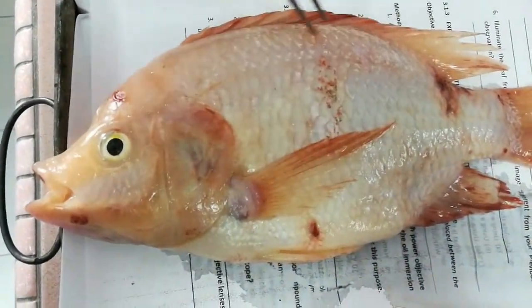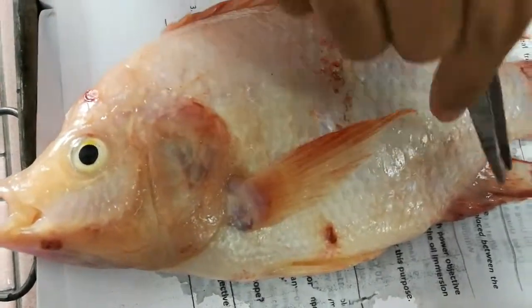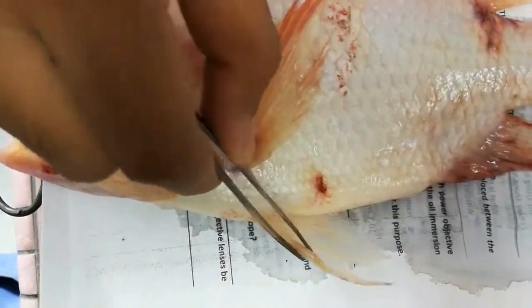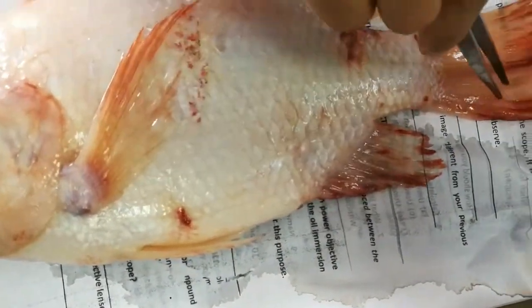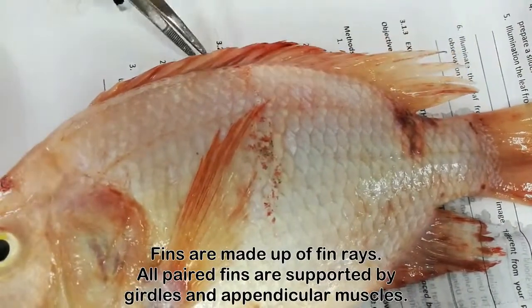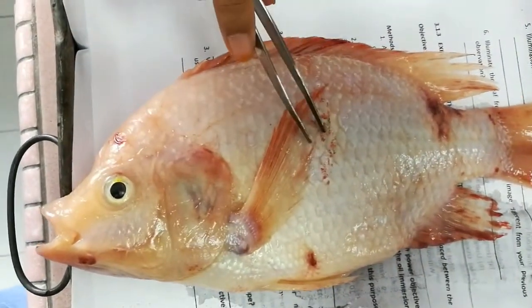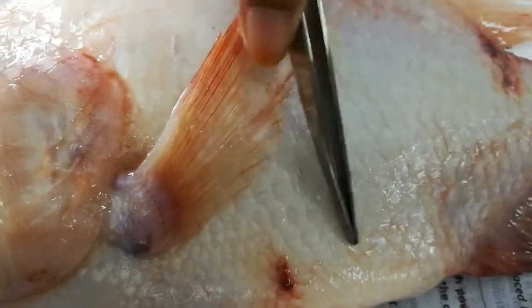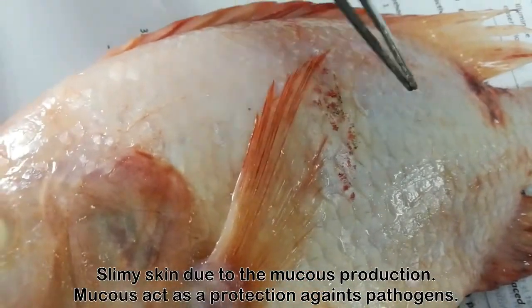We will proceed with the trunk or body. For the body, you can see there are several fins. The first fin is the pectoral fin, the bottom one is the pelvic fin, then the anal fin, caudal fin, and also dorsal fin. You can see the fins are actually spinous fins. The skin of the fish is quite slimy and mucous due to mucous production from the epidermis.